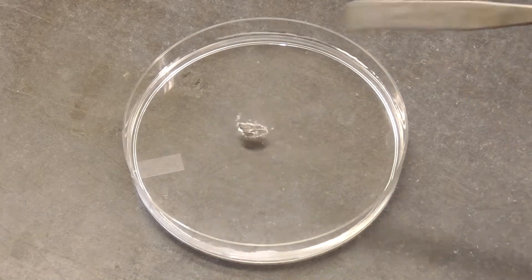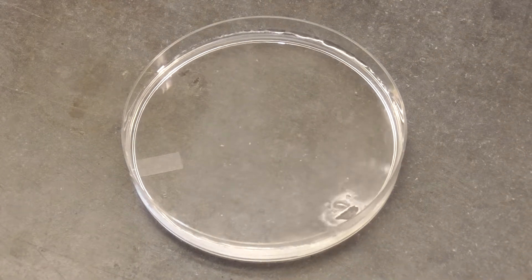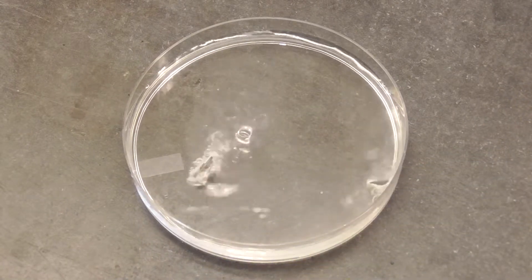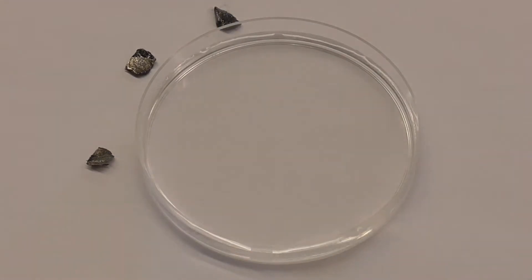Here you can see me adding a few shavings of lithium metal to some water so you can see what I'm talking about. Now the alkali metals are so named because when they react with water they form a base or alkali. Let's show you how we can see this effect. Here I'm adding a little bit of a chemical that turns blue in the presence of a base.